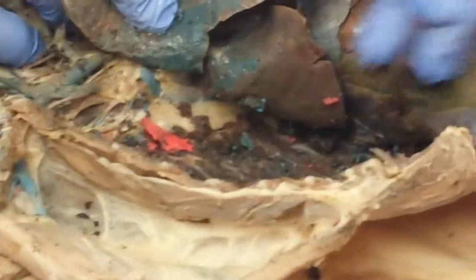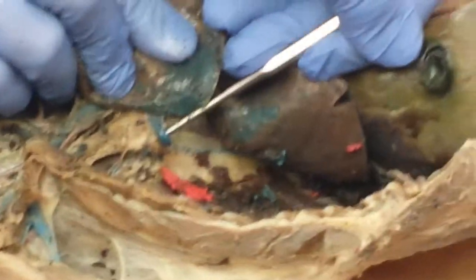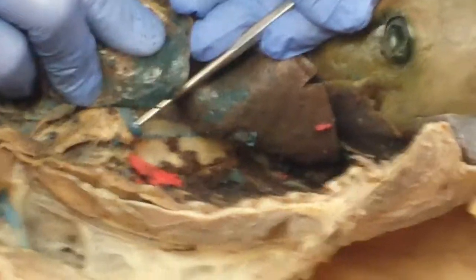If we look here for venous supply coming back from above the diaphragm and from the intercostals here, notice there's a big vein right here, dumps right into the superior vena cava just before it enters the right atrium. This is called the azygous, A-Z-Y-G-O-U-S vein. Okay? So now we follow the blood flow of the aorta through the chest, through the diaphragm, where it becomes now the abdominal aorta right here.